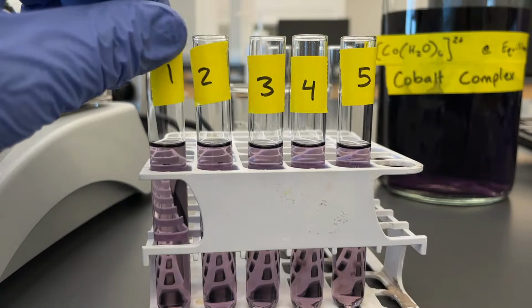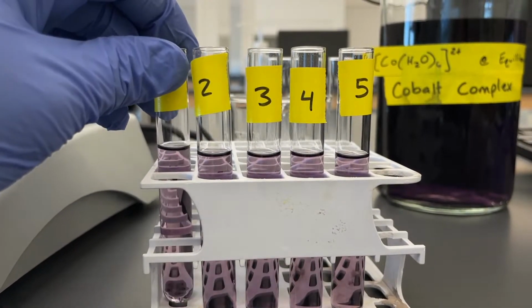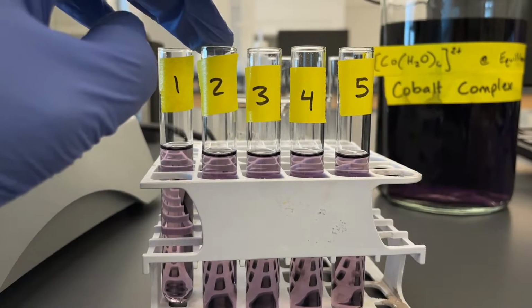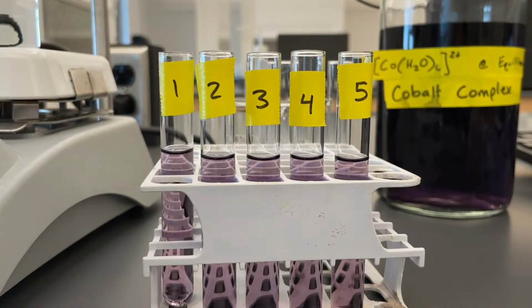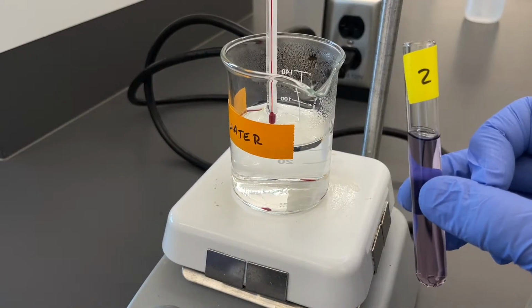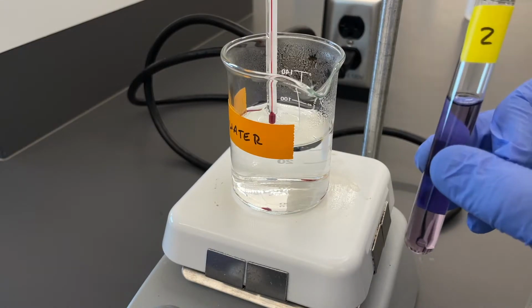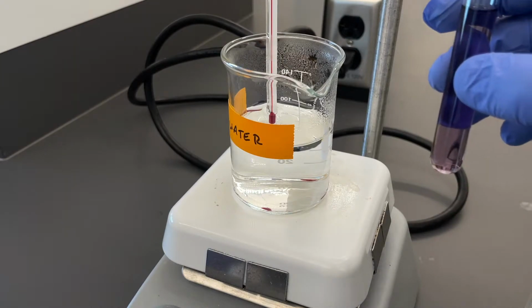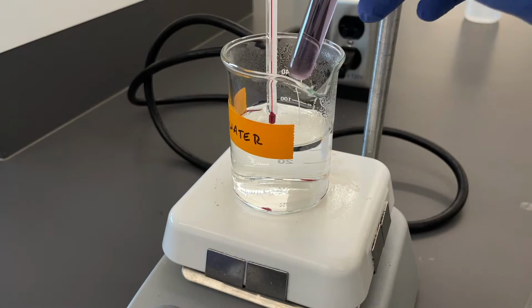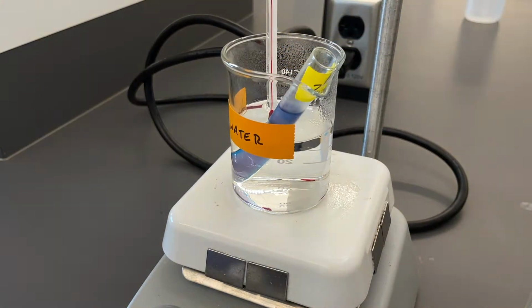We'll leave number 1 as our reference tube, meaning this one we won't do anything with it. We'll just leave that one so that way we can compare all of the equilibrium changes to our control test tube. So we'll start off with test tube number 2, which will undergo 2 different temperature changes to determine the shift of the equilibrium. We have our hot water bath that just hit about 80 degrees C, and so now it's ready to go. We'll put this test tube in here. We'll leave it in there for about 2 minutes or so.